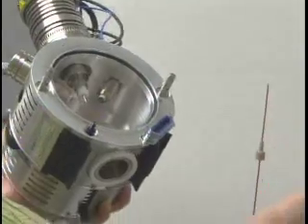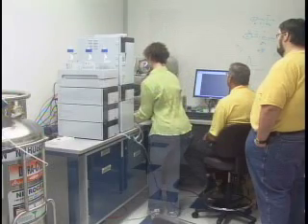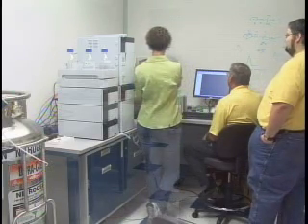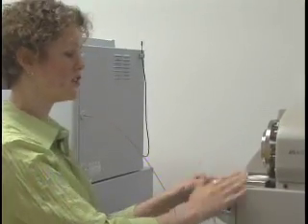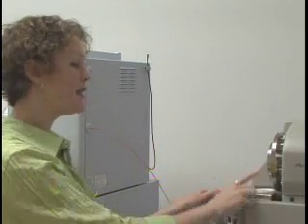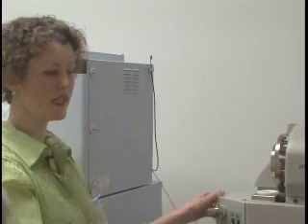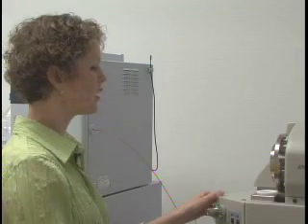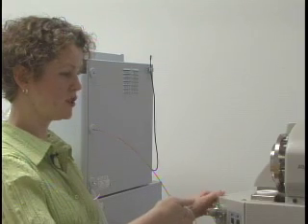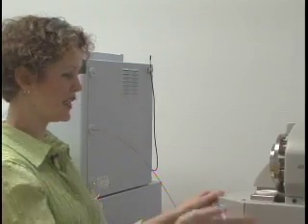This is the curtain plate right here. We clean it every time before we use the system — you want to clean it every day. Behind this is the orifice plate, and all these parts were covered in the lecture portion of this workshop. With this particular setup, since it's sprayed perpendicular to the sample introduction plate, the orifice plate doesn't need to be cleaned nearly as frequently — only occasionally.